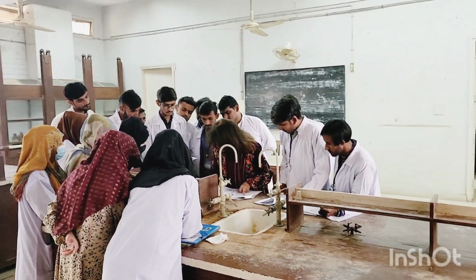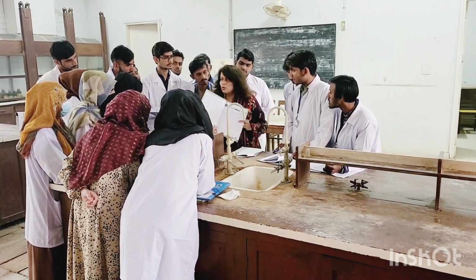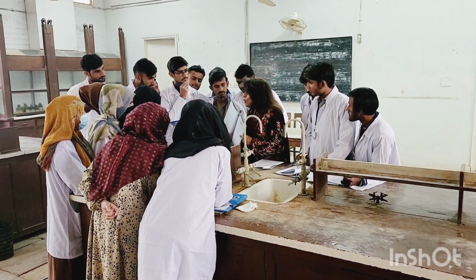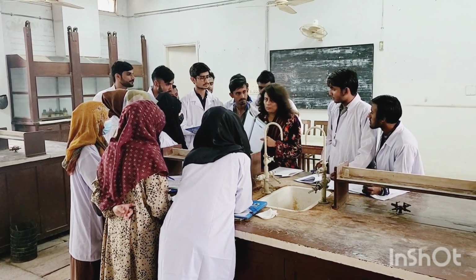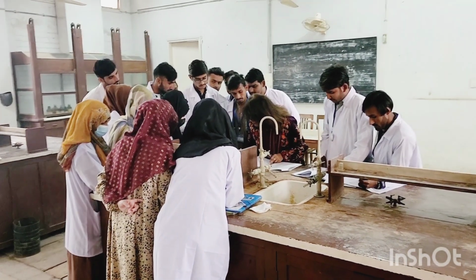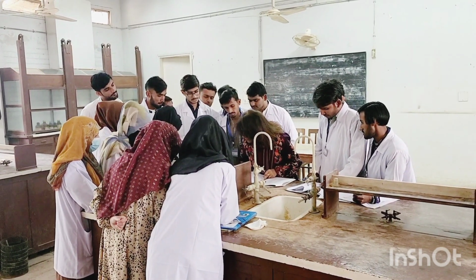Here you can write down experiment. What I am doing here is telling you how to make your journal, the format of your experimental process. This is the format you all are supposed to adopt when you are going through the process. Take a snapshot of this. Okay, and then start. Experiment, observation, inference or results.